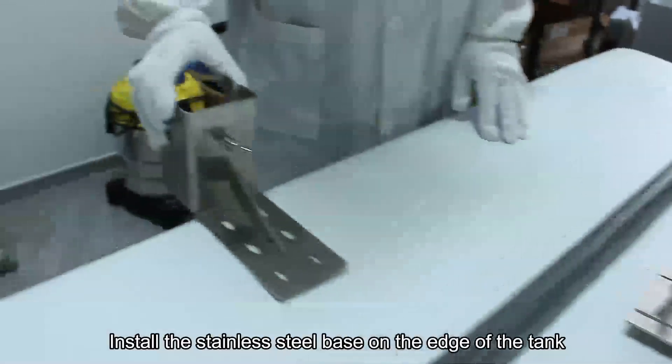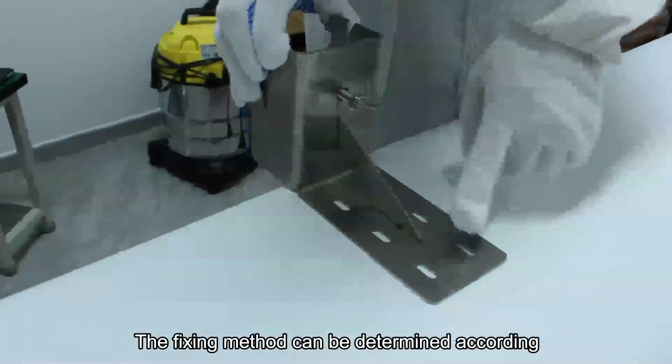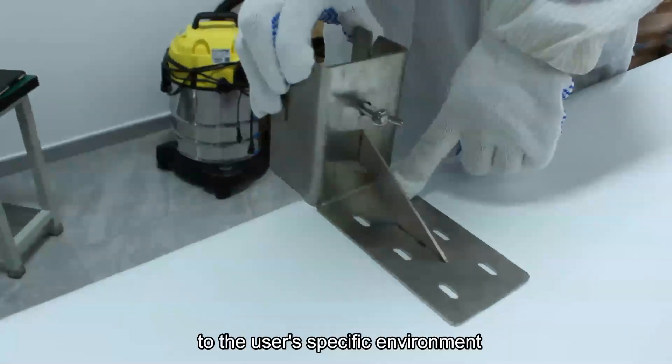Install the stainless steel base on the edge of the tank. The fixing method can be determined according to the user-specific environment.